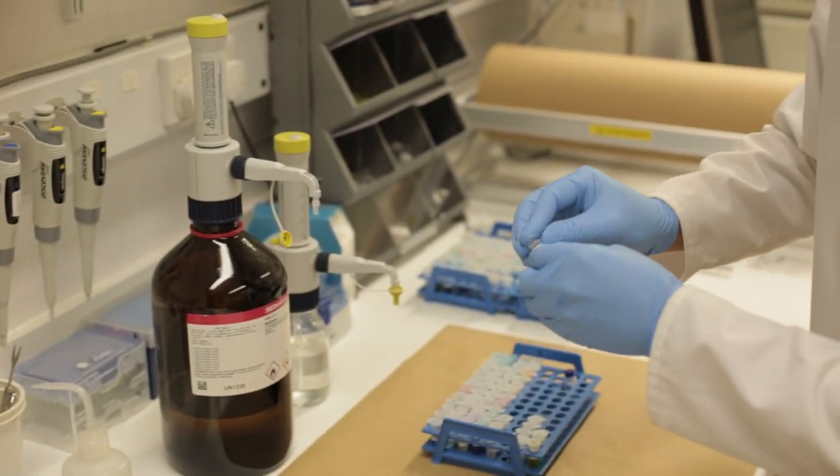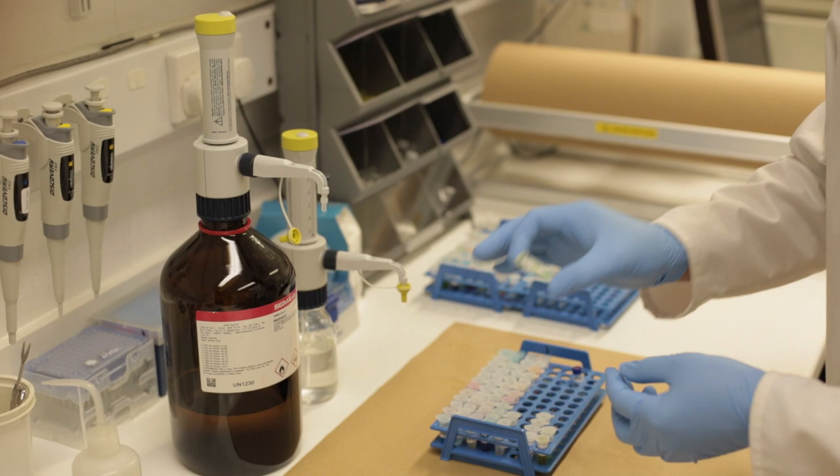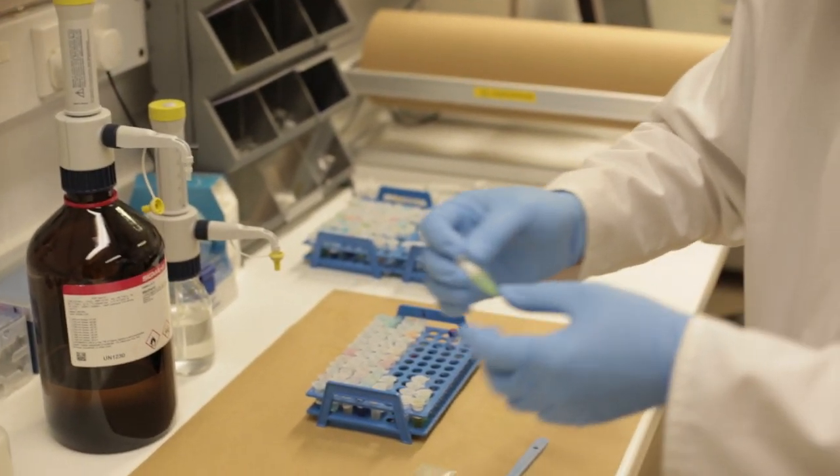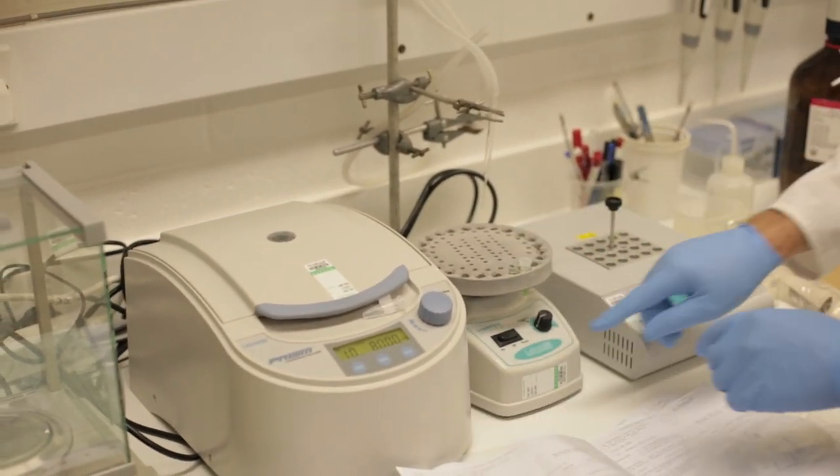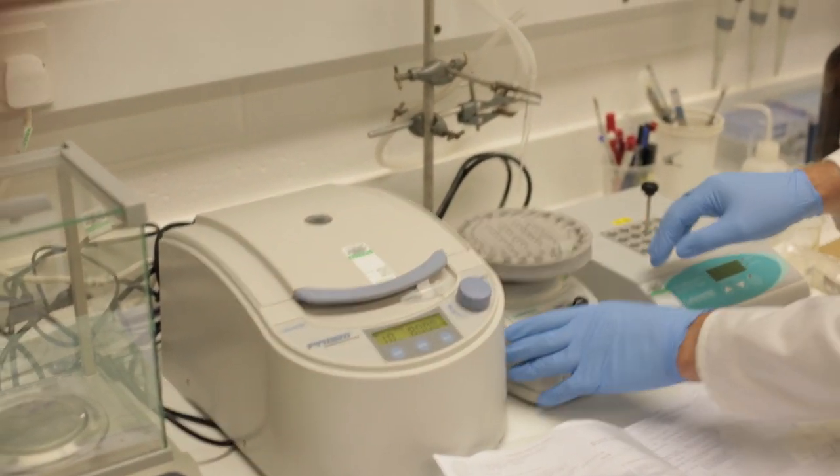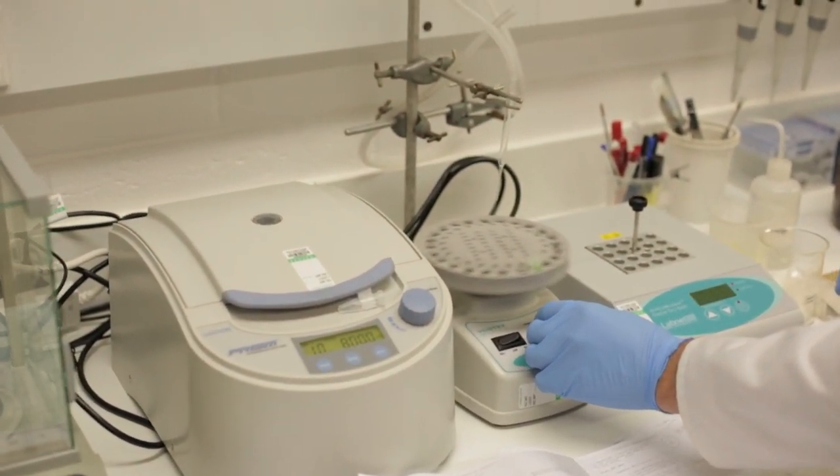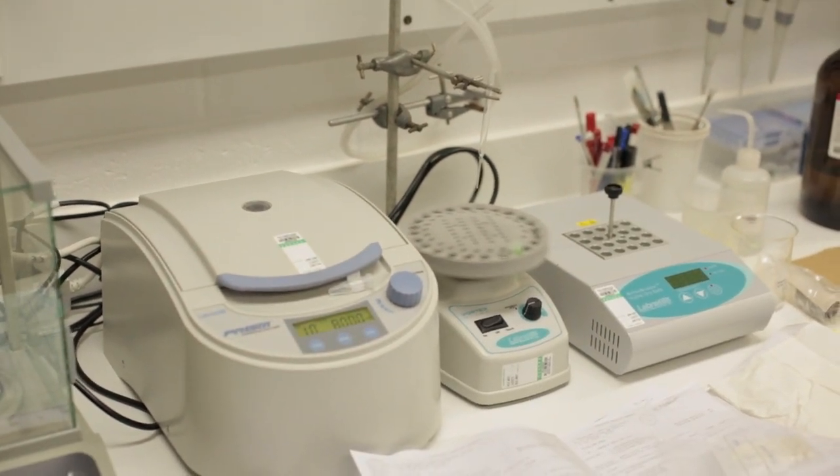So we've added one milliliter of methanol to the tablet and now we need to let that extract. So we're going to put it on a machine which shakes it. We'll let that run for a few minutes and that will extract all the drug from the tablet into the methanol.